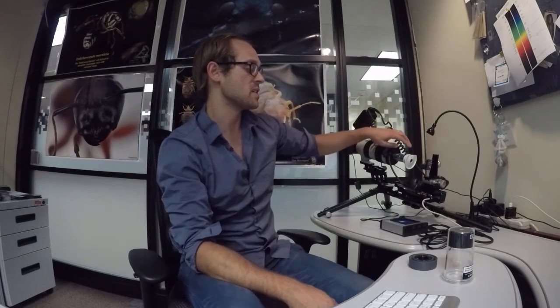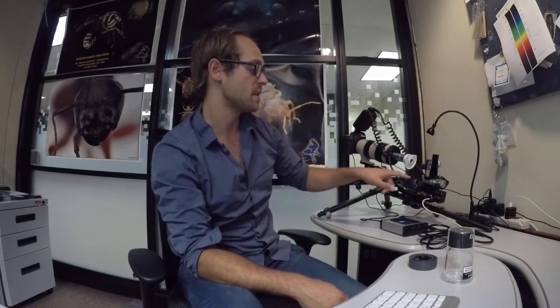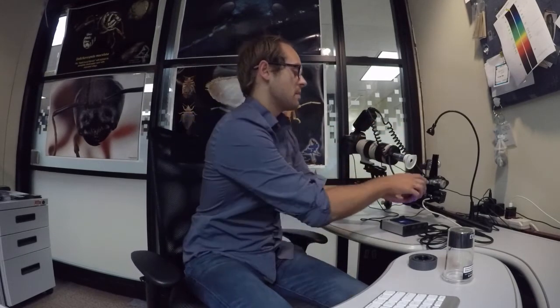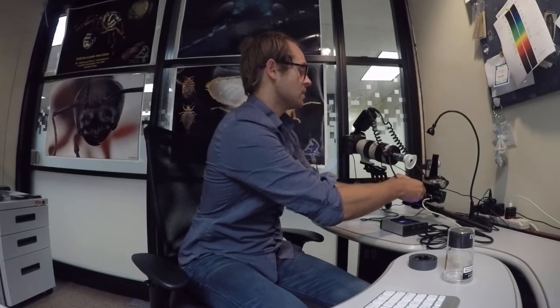Because the pin is not going to get in the way, flat end is going to be up, that way we're maximizing a lot of light that's going to be bouncing off the front of this diffuser.